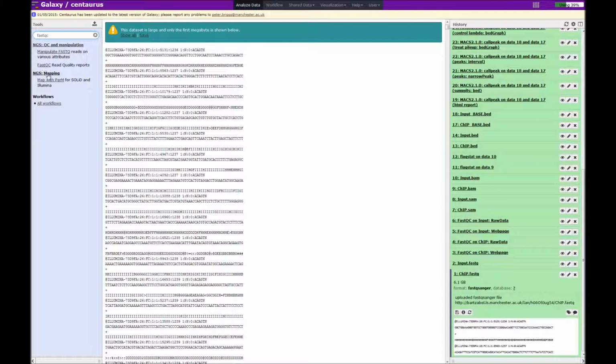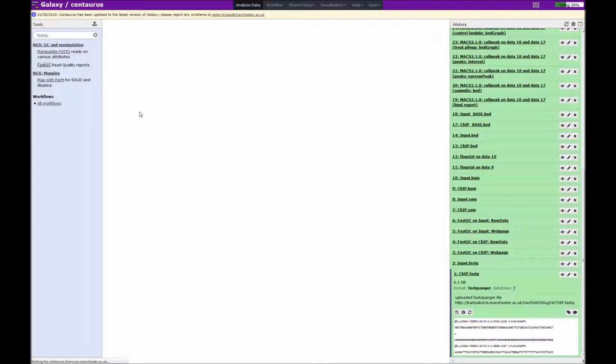Incidentally, this is a tool that is available off of the public toolshed. So if we click on that, it will bring the tool interface into the middle panel.